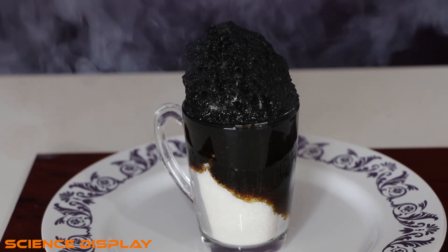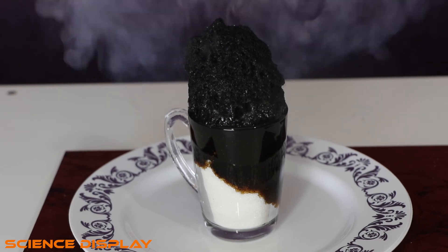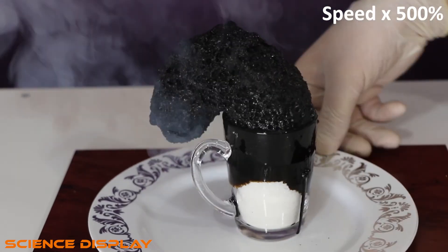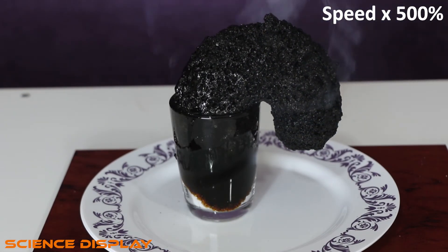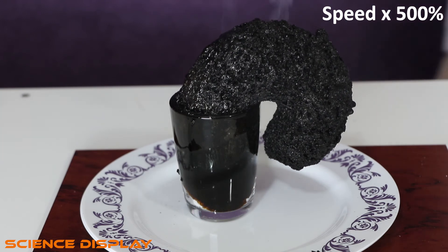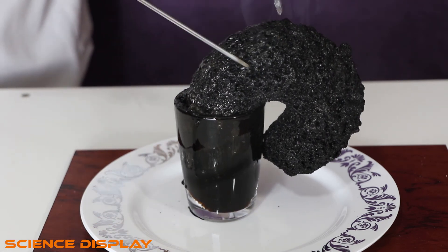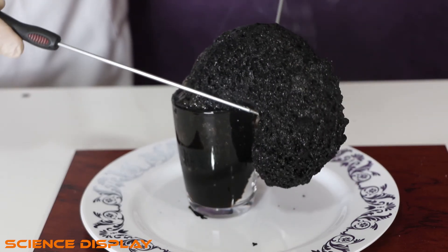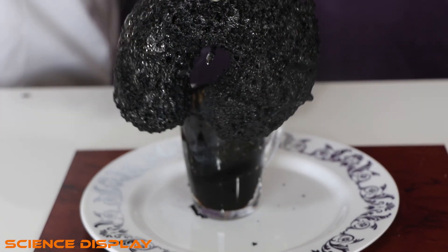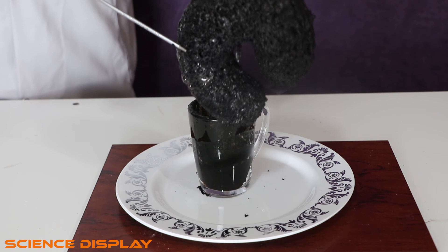Yeah, look at that — it's moving up, it's trying to raise to the sky. Look at that, it's a rigid body now. I'm trying to take it out. This is the sugar, and when it reacts with the sulfuric acid, it takes this shape.